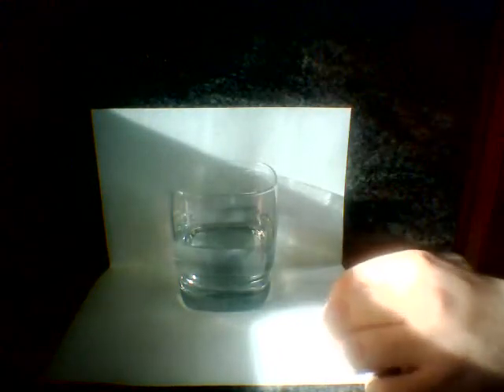I have the sodium metal right here, and there's the water. So let's do this. You can see the sodium bubbling, leaving sort of a purple cloud behind it as it goes.